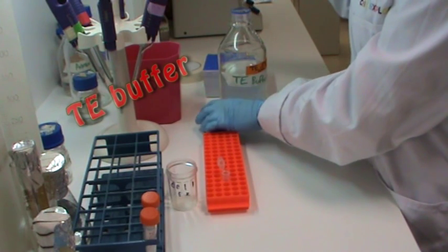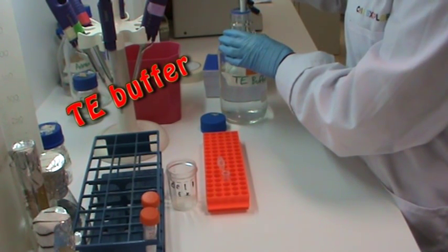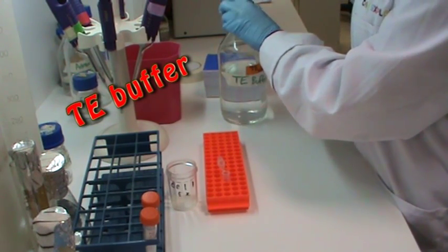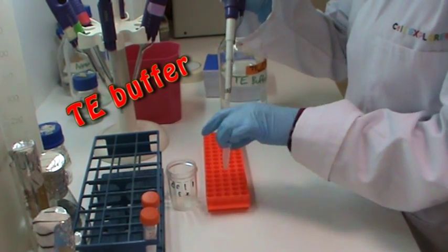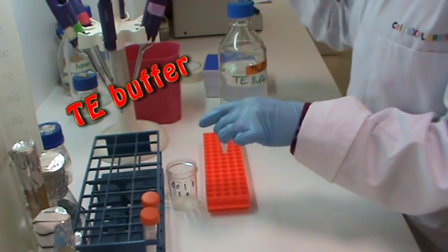Finally, I am resuspending the DNA in TE buffer. This will prevent the DNA from being degraded.